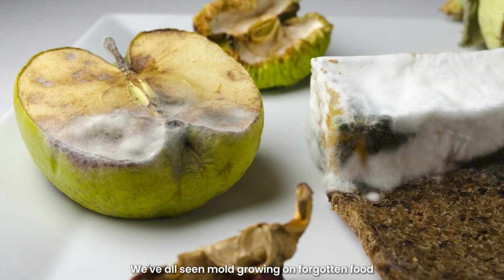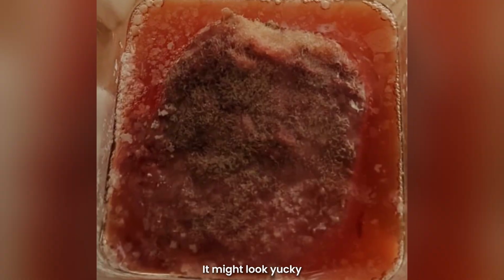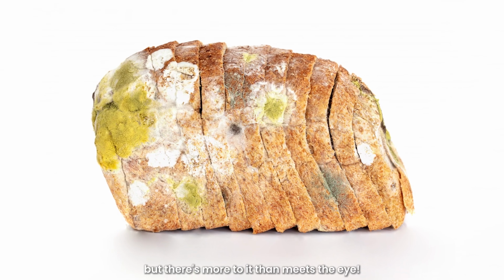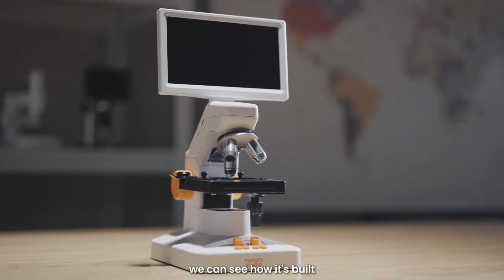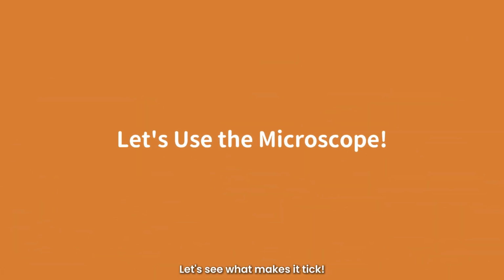Today, we're going to explore a moldy strawberry. We've all seen mold growing on forgotten food. It might look yucky, but there's more to it than meets the eye. Mold is a living organism, and under the microscope, we can see how it's built. Let's see what makes it tick.